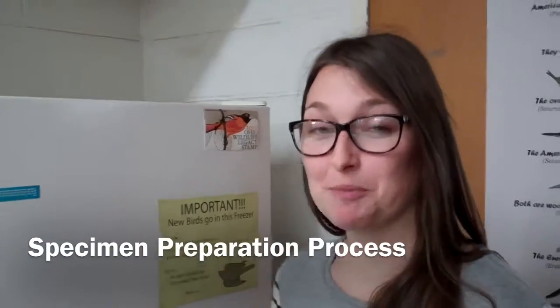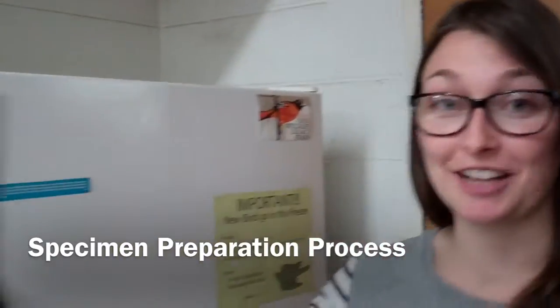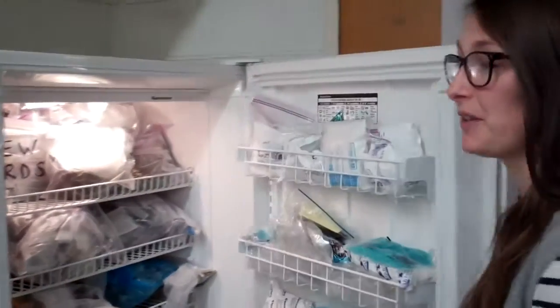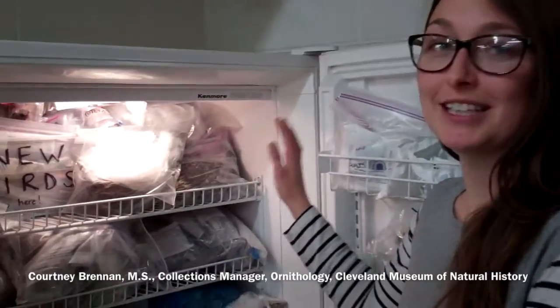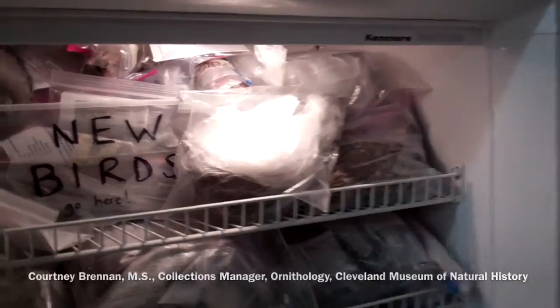Okay, so the very beginning of our specimen preparation begins here at the freezers where birds that we get from the public and from the rehab centers are held in the freezer until we are ready to process them.